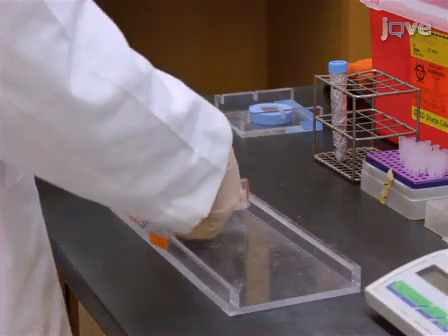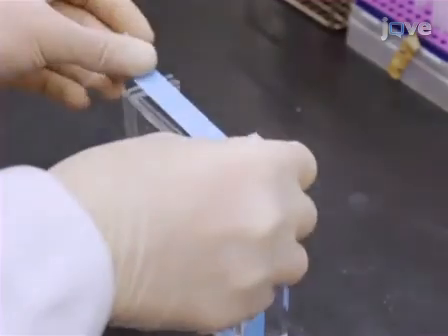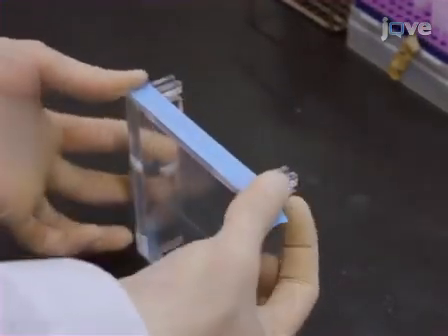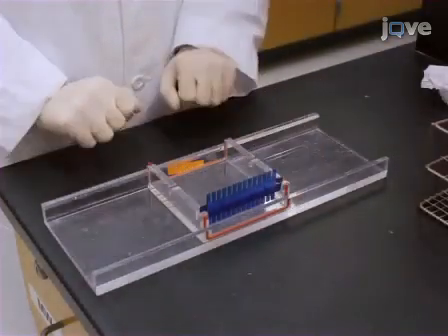While the agarose is cooling, prepare the gel mold by placing the gel tray into the casting apparatus. Alternatively, one may tape the open edges of a gel tray to create a mold. Place an appropriate comb into the gel mold to create the wells.